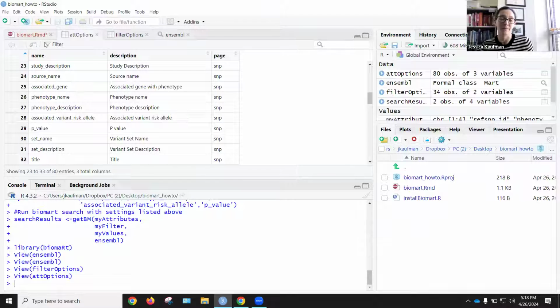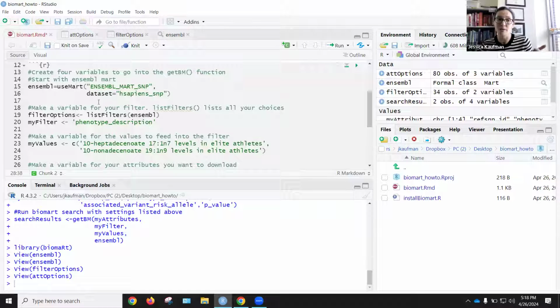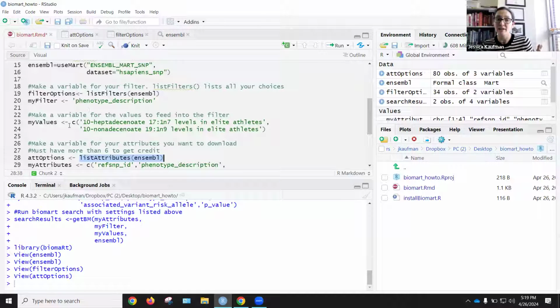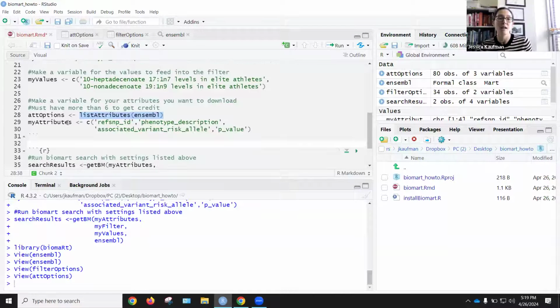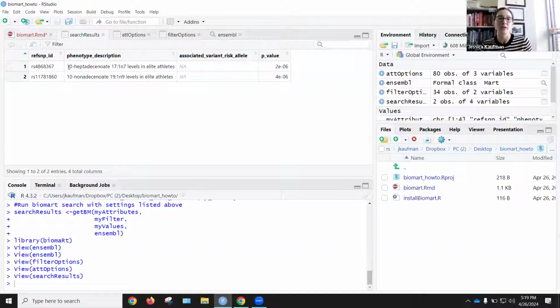Once you've defined each of these 4 variables, the mart, ensembl, the filter, my filter, the values, the types of phenotypes that match the phenotype descriptions in the large 15,000 row file, and my attributes, you're ready to run your search. Once you run your search, you will get results with columns for all the information you specified in attributes and any SNPs in the database that match these phenotypes. Because I only picked 2 phenotypes and they were very specific, they're the first 2 in the phenotypes option file, I only end up with 2 rows, but I have done a successful biomart search.